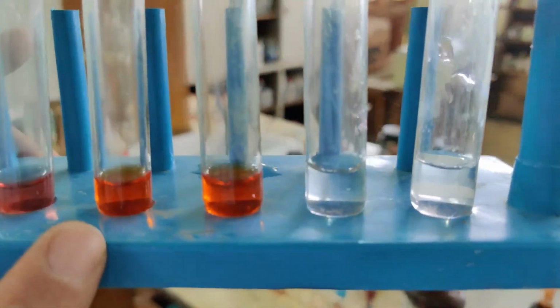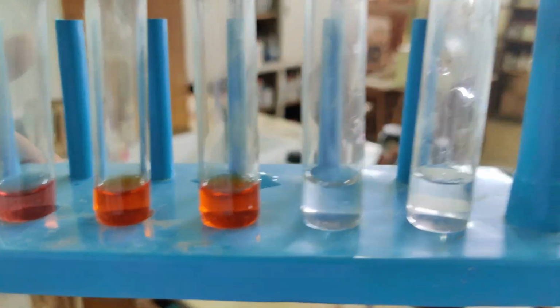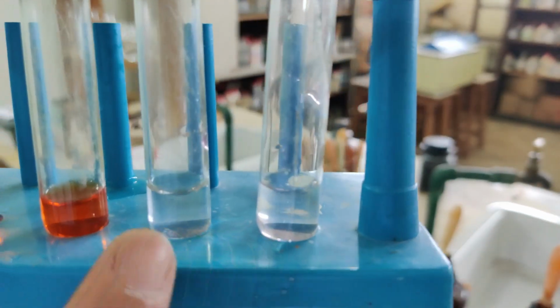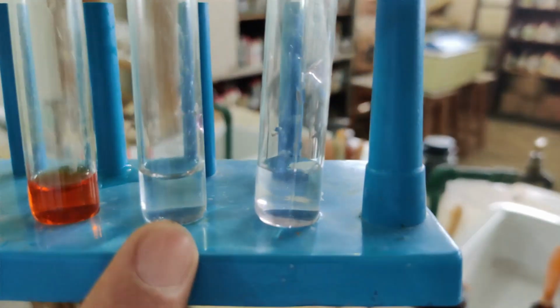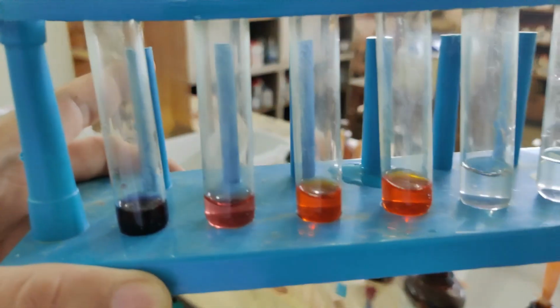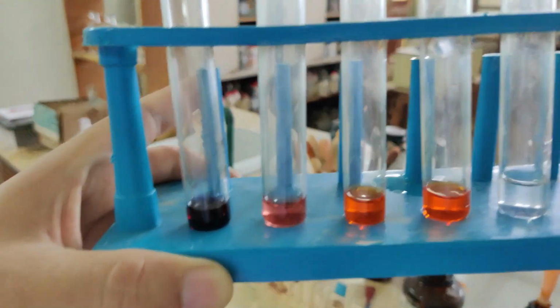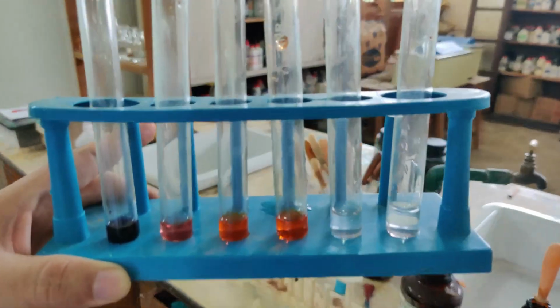And why have I put in 2 test tubes? Because one I want to test with acid, the other one with base, and you will see what color changes take place in both of these. Then in both these test tubes I have added phenolphthalein, because one I am going to test with acid, the other with base. Now you see the original colors. Since I am going to add drop by drop the 2 solutions, you can see the 2 solutions which I am going to use.